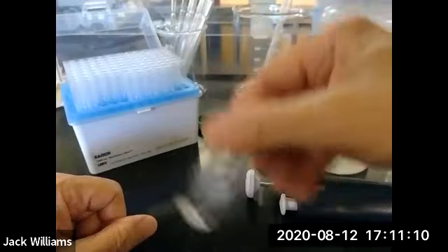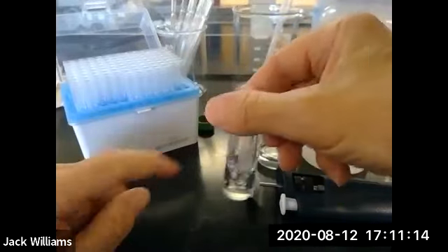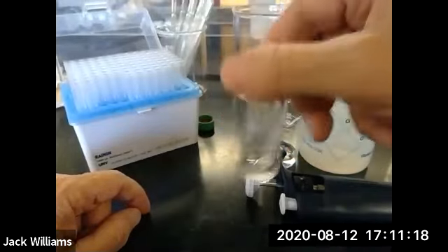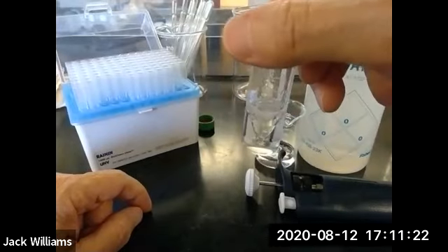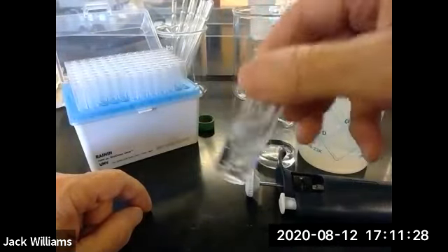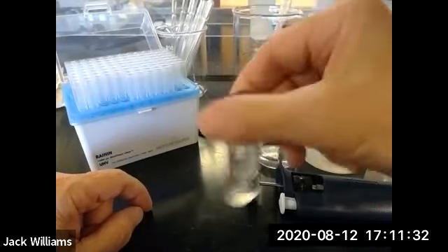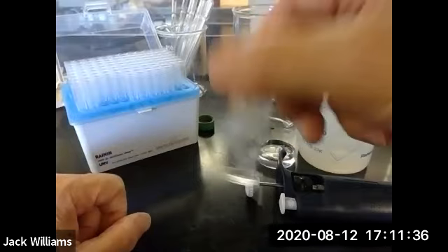So you're going to swirl these around. And you can see it kind of forms 2 layers. Bubbles in the center. That's actually called an emulsion. And it settles out pretty quickly. But sometimes these things are stable and they don't settle out. That can sometimes be a real problem in organic chemistry when you're trying to do extractions. So just maybe give it a couple of minutes.